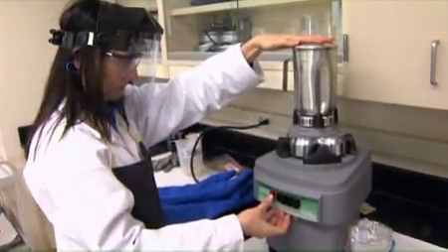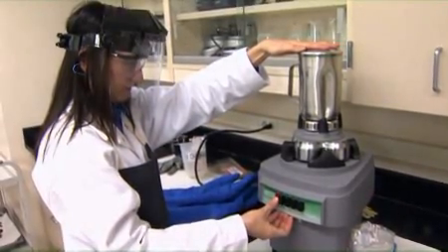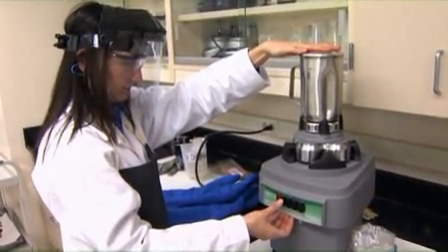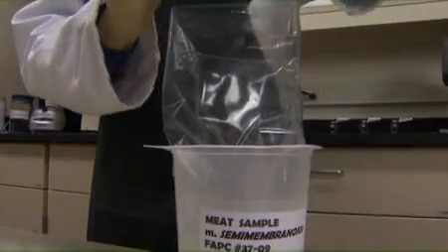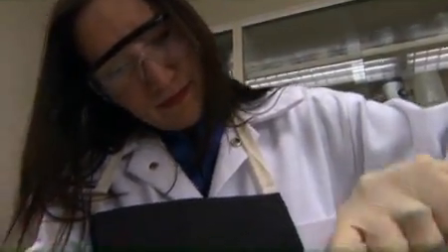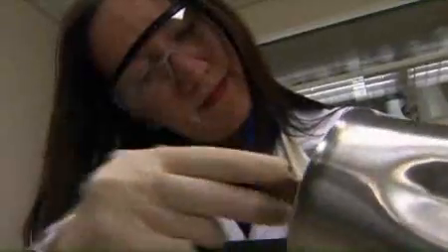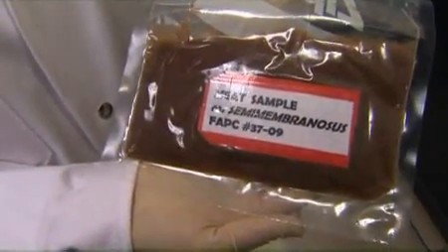Blend meat until powder-like by using pulses of 30 to 60 seconds at a time. Quickly remove the pulverized meat from the container by scraping with a spatula and transferring to a plastic bag. Repeat the process until the entire sample has been pulverized. Vacuum seal the sample bag and store it in the freezer until analysis.